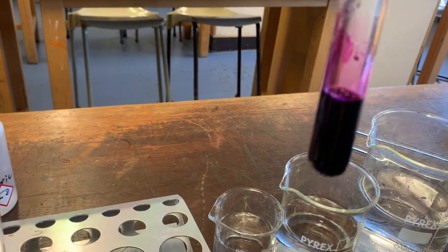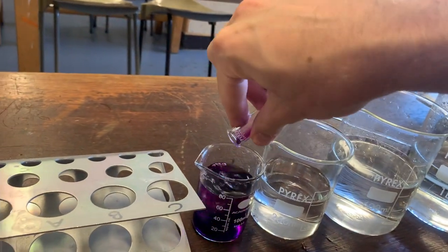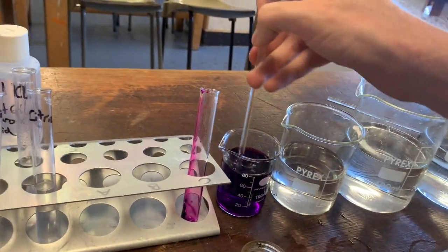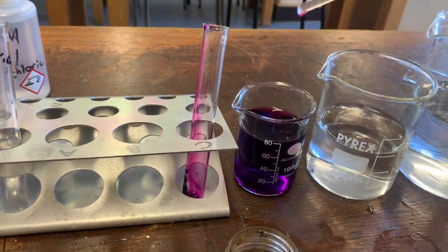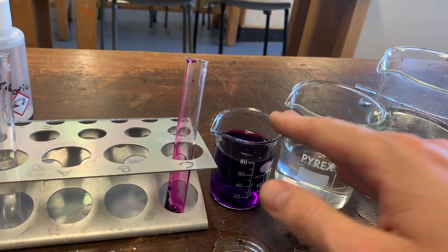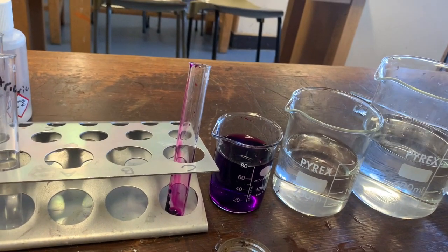It's very, very dark, as you can see here. If I take this concentrated solution and pour it into more water, you can see that the colour is a little bit lighter, and that's because it is diluted. There's the same number of particles of potassium permanganate in here as there are in here, but in here there's more water, and so therefore the concentration is lower.